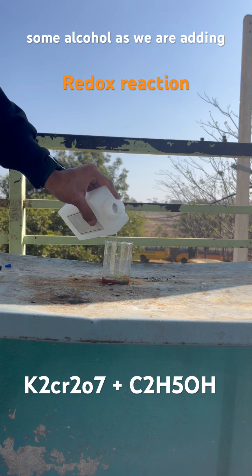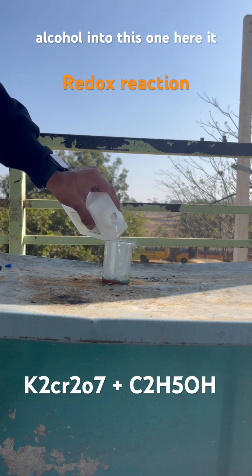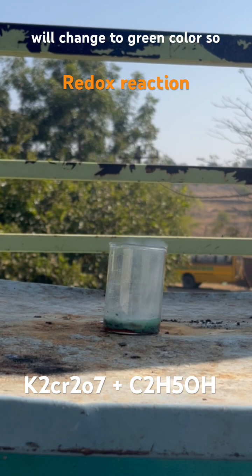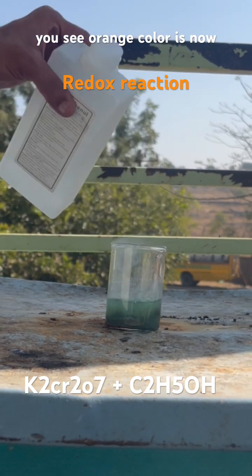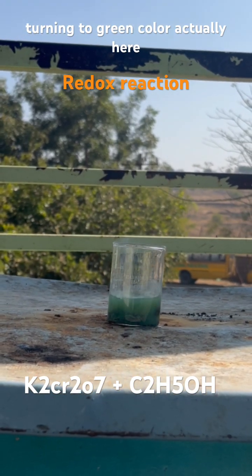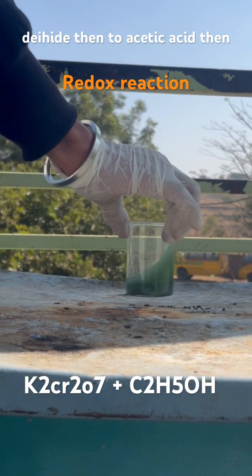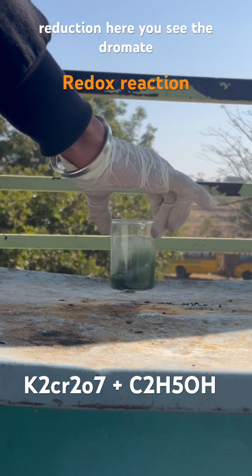We are now adding some alcohol. As we add the alcohol, you can see the color changing to green. The orange color is turning to green. Ethanol is first oxidized to acetaldehyde, then to acetic acid.